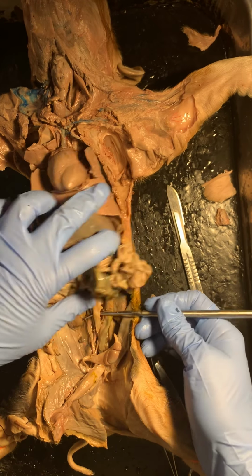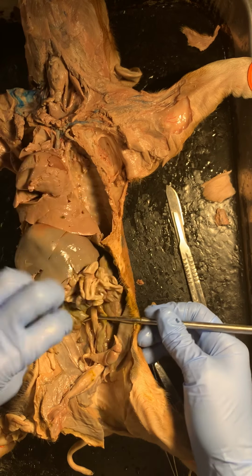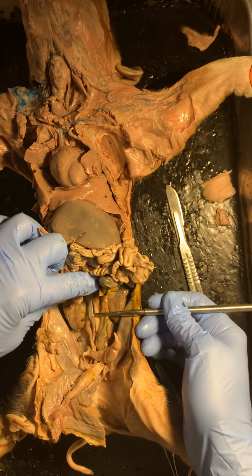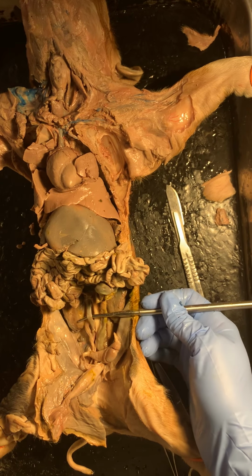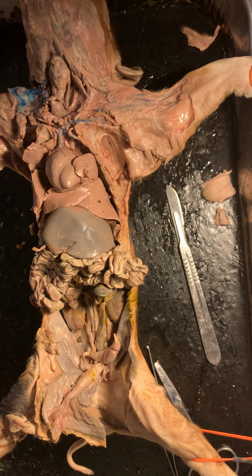So let's be specific. Yeah, let's call this one up on top. We're going to call this one the thoracic aorta. And then down here, we're going to call this one the abdominal aorta. And then you have your inferior vena cava. So second place to tag your inferior vena cava here. All right, and that is the major blood vessels that we'll cover on your pig dissection.